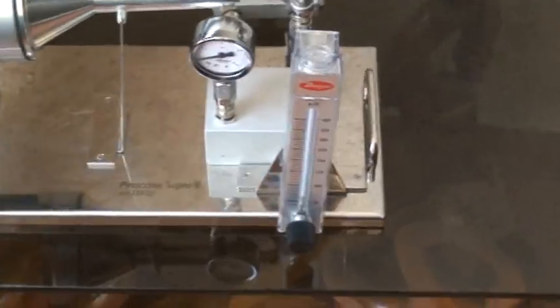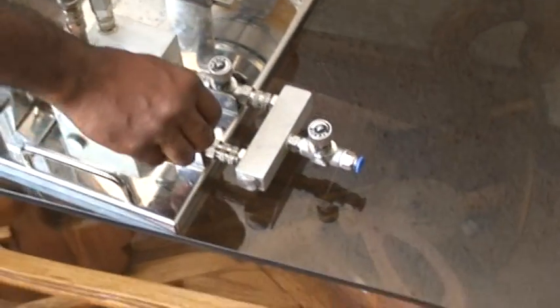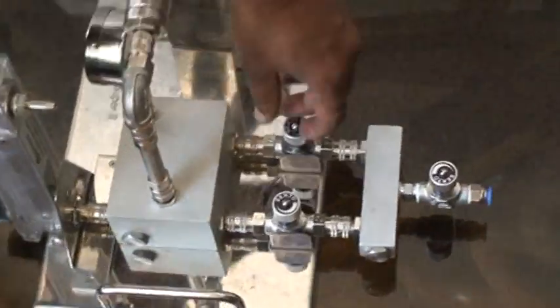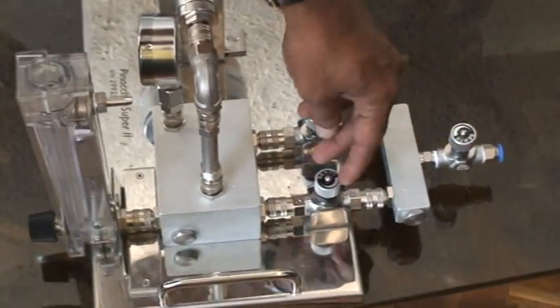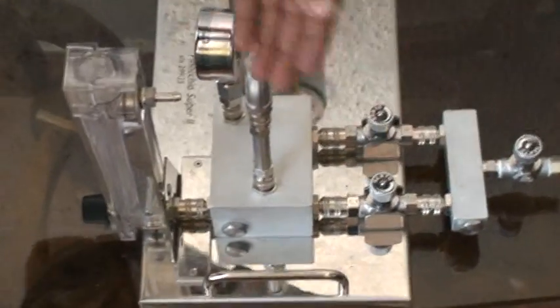The compressed air system is portable — anyone can carry it from one place to another. It is very simple to use. You connect the compressed air here, first keep valve one closed, connect the compressed air, open this valve, open this valve, and adjust the flow to 100 liters per minute.